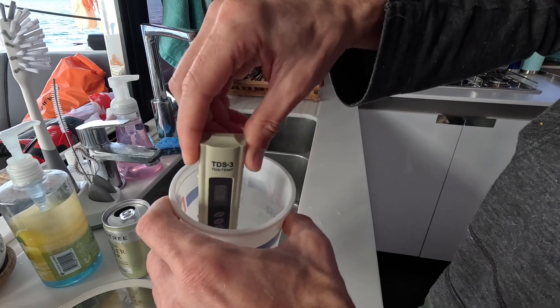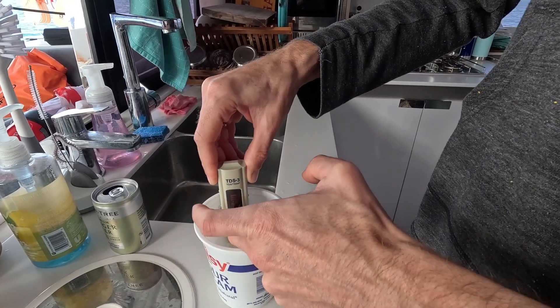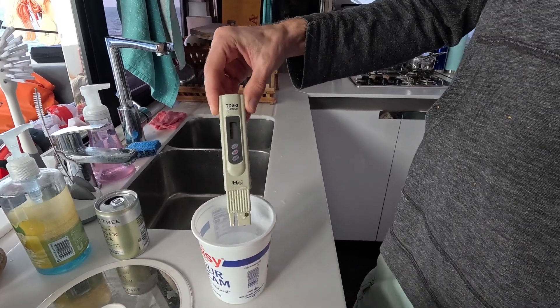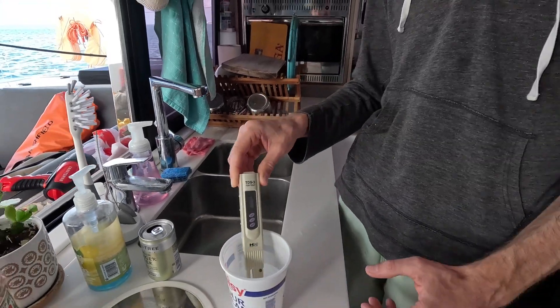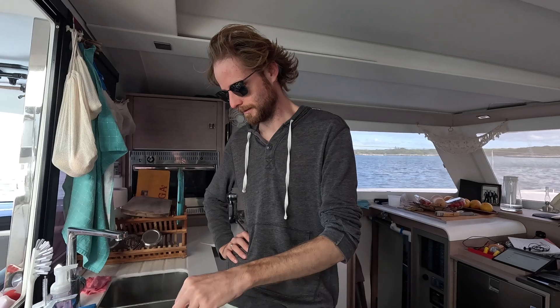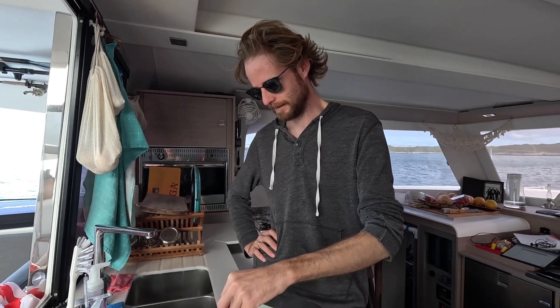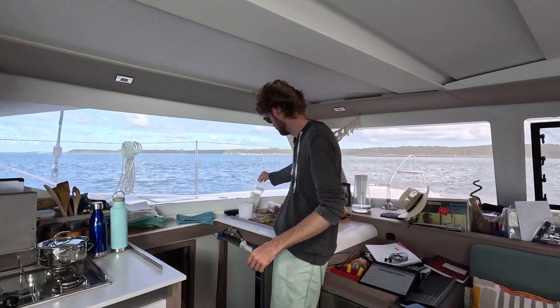It's 595 — and that's not even pure. It settles consistently at 595, and it has a distinctive salty taste to it. The spectra we've seen is around 150 to 250, which is what our RO system puts out.